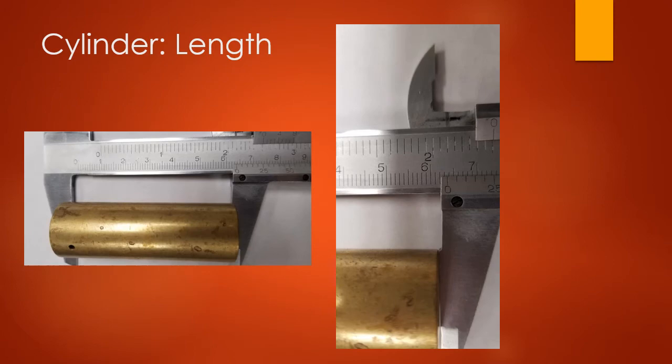Next, we're going to look at a cylinder. Number 2 of the procedure in your lab manual talks about an engine in a boat with a displacement of 350 inches cubed. That's not going to require any actual measurements, so that's why I'm skipping over number 2. That is just a conversion question for you to work on. I'm now looking at number 3 still on page 19, and it says using a plastic metric ruler, measure the length, diameter, and radius of a metal cylinder.